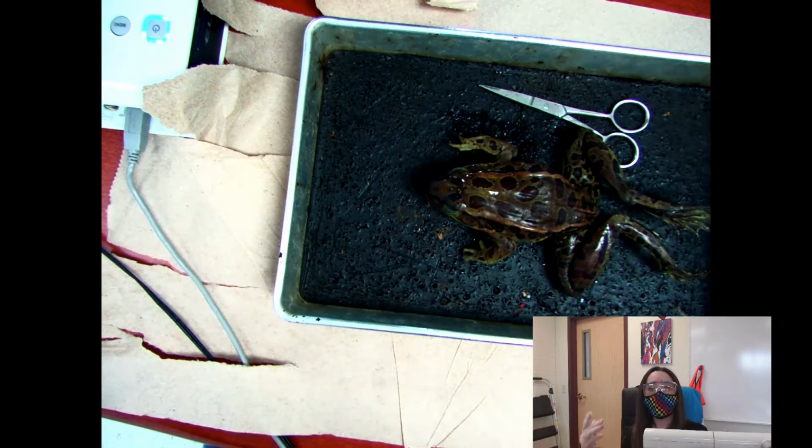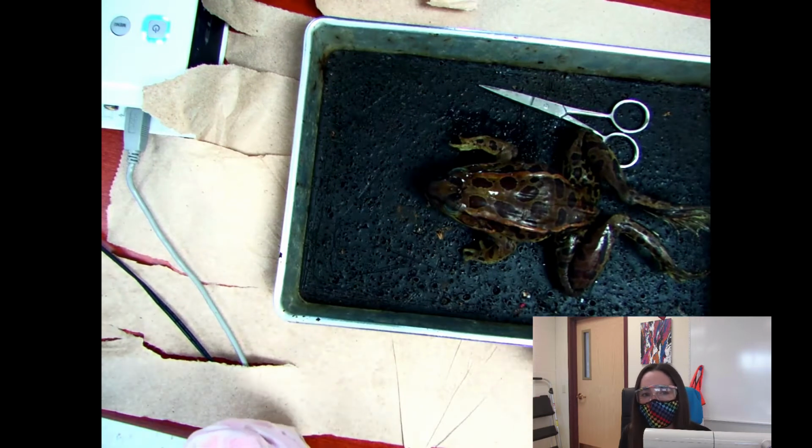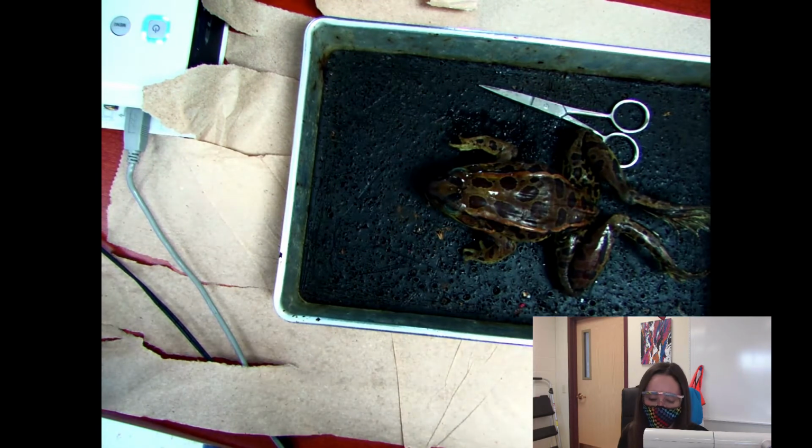Hi everyone, I'm Mrs. Newcomb, and we are going to do the frog dissection. Are you guys excited? Are you guys ready? I don't know if you can ever be ready for the frog dissection. It's kind of weird too.